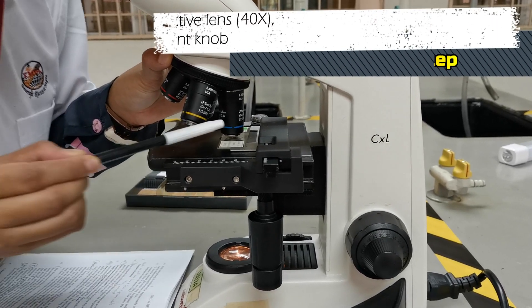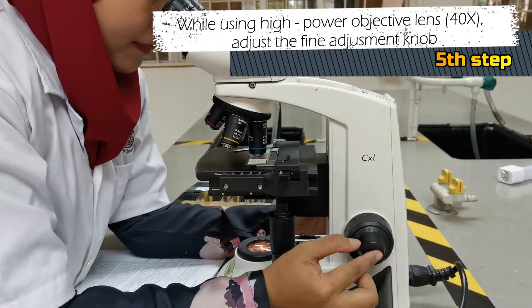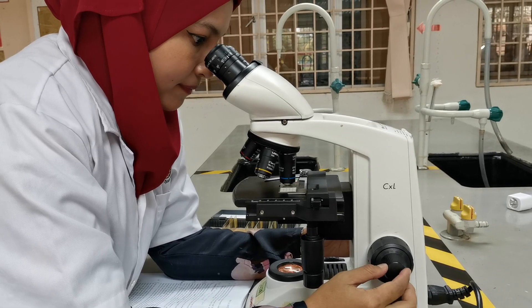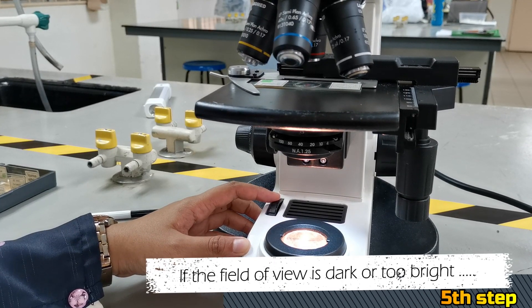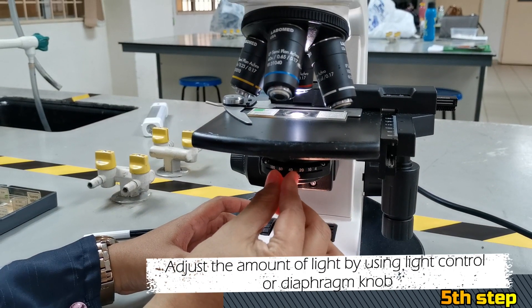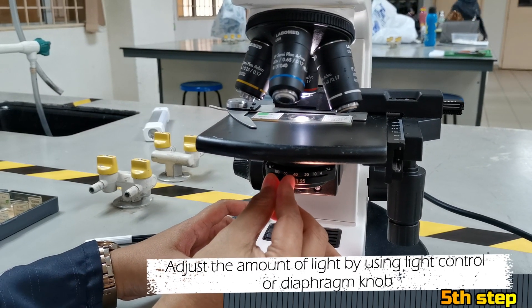Fifth, while using the high power objective lens, you need to adjust the fine adjustment knob. If the field of view is dark or too bright, adjust the amount of light by using the light control or diaphragm knob.